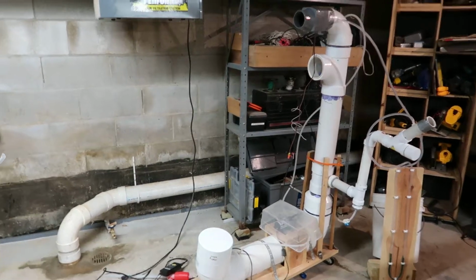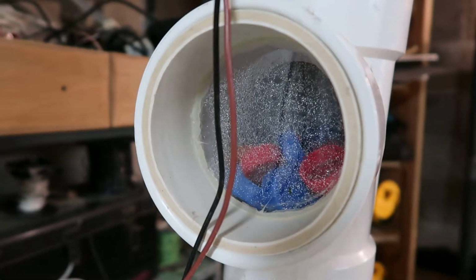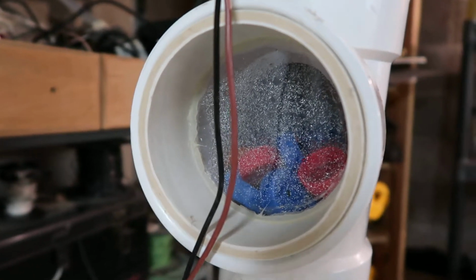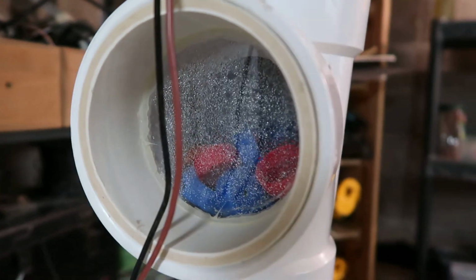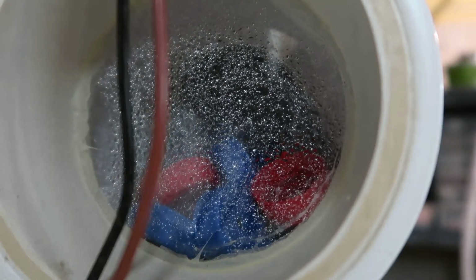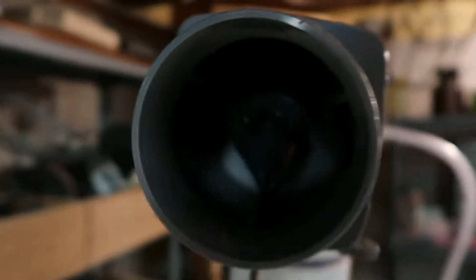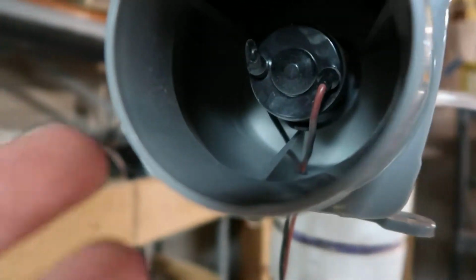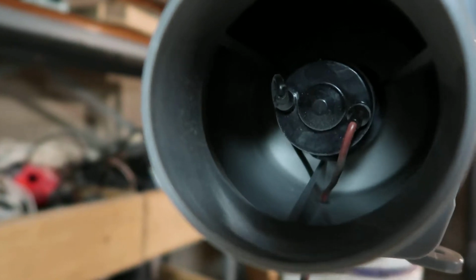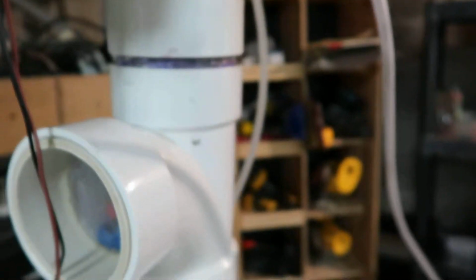So I'll just pull the camera off the tripod. And over here, internally, you can watch the water beat up on the inside of that to show that, hey, I've got flow. That's an in-process check. I don't have a flashlight or anything, but you can see that it's going. This up here is working very well. You'd be seeing condensate build up on the camera if there was water making its way past, so the demister pad is doing what it should do.